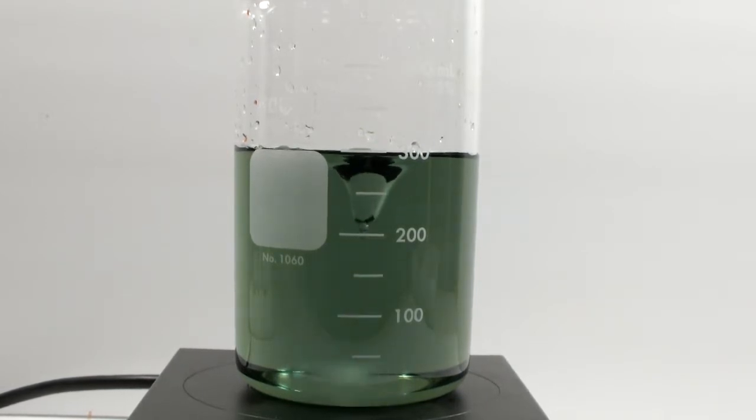Well, we have something like an oscillation here. It started with the green, and then went to blue, and it was a lovely blue indeed, but then it went straight back to green. The oscillations seem to go between green and blue, and as the reaction progresses, it seems like a little reddish-purple tinge develops. This tells me that something is wrong.